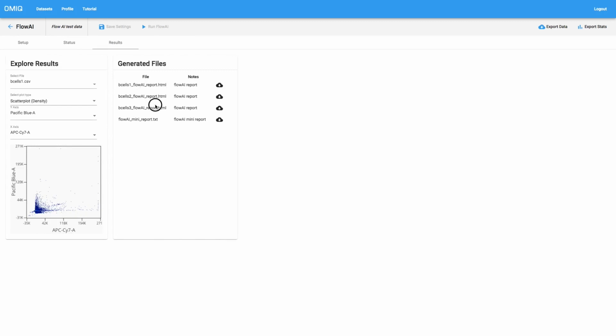The first is these reports, and the reports will be listed under the generated files organizer in the results. They'll be broken down based on every single file that was run through the analysis. Each file will be analyzed on its own by Flow AI and will produce its own report. These reports are HTML documents, so you need to download them and then open them in a web browser in order to view them. We also have this mini report, which gives just the most basic information about each file, organized as a single report document. For now, what we'll do is look at the results for this file.